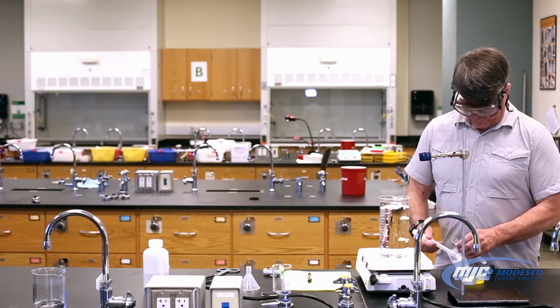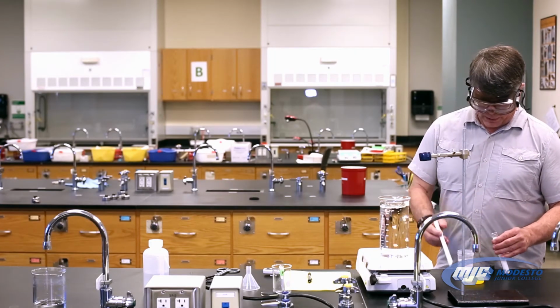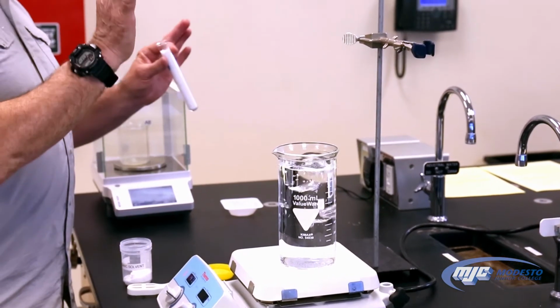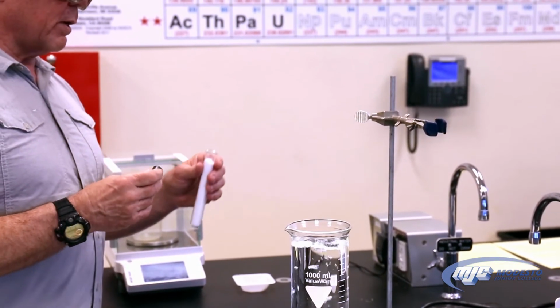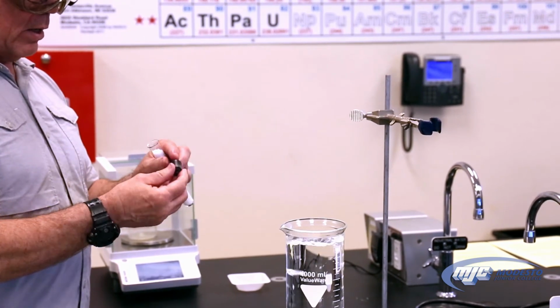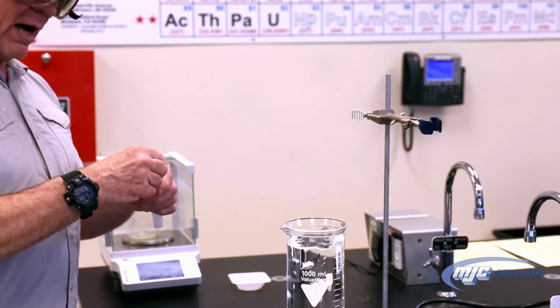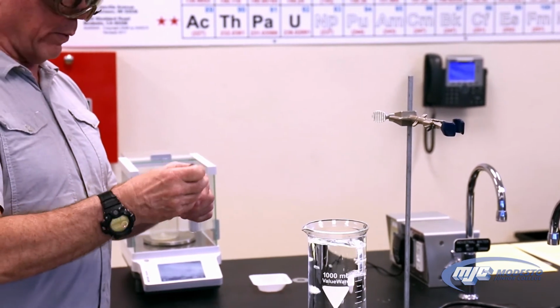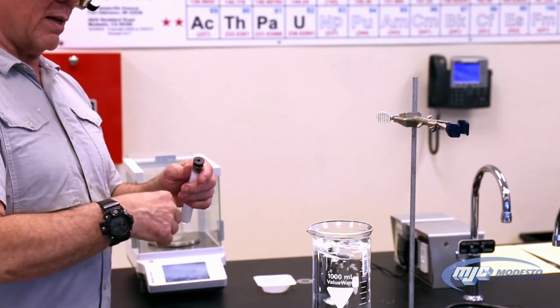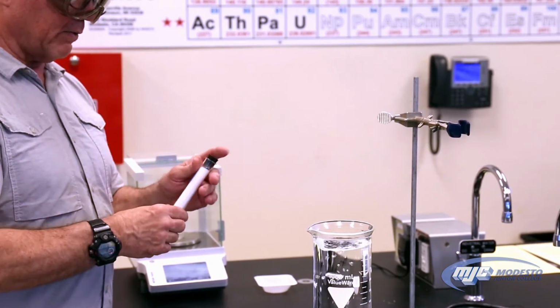So now what I'm going to do is take my rubber stopper. It's a one-hole rubber stopper. And we always do this with rubber stoppers before we put them in glassware. There's a wide end and a narrow end. We take the wide end and make sure it does not fit in the hole, because if it does, when we turn it around this way and put it the way it's supposed to go, it'll go all the way in and then get stuck. And you have to break the glass to get it out.